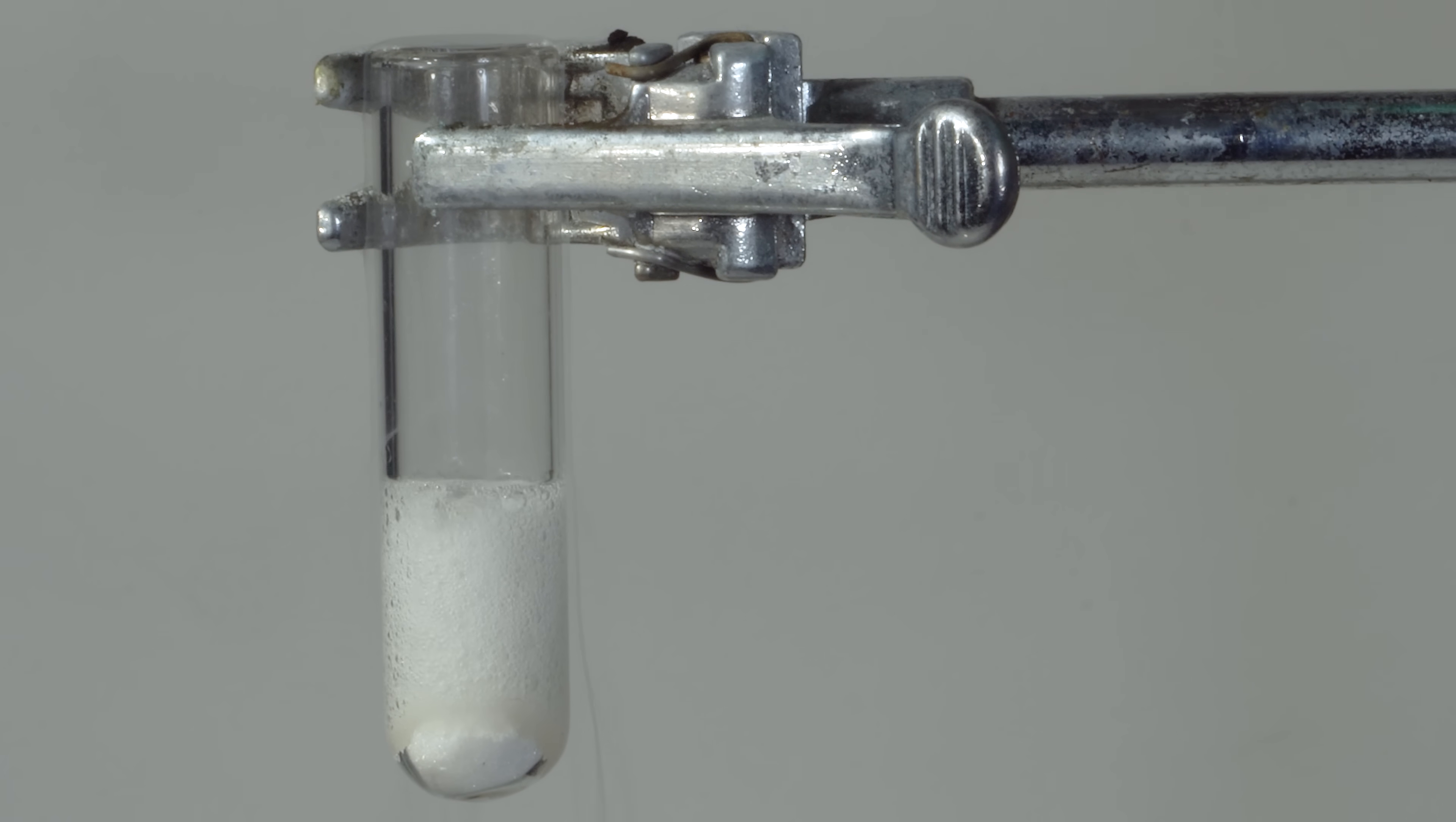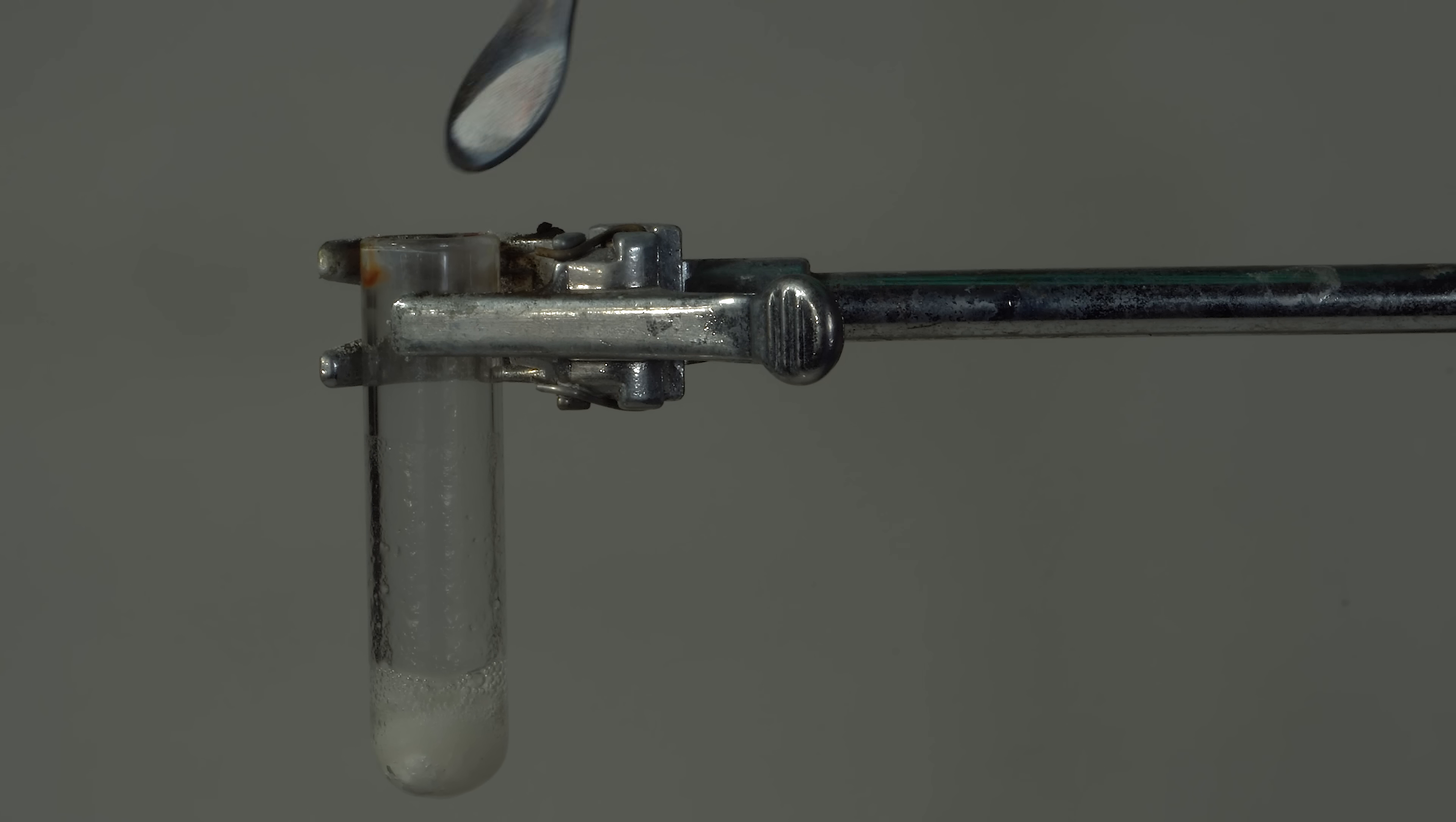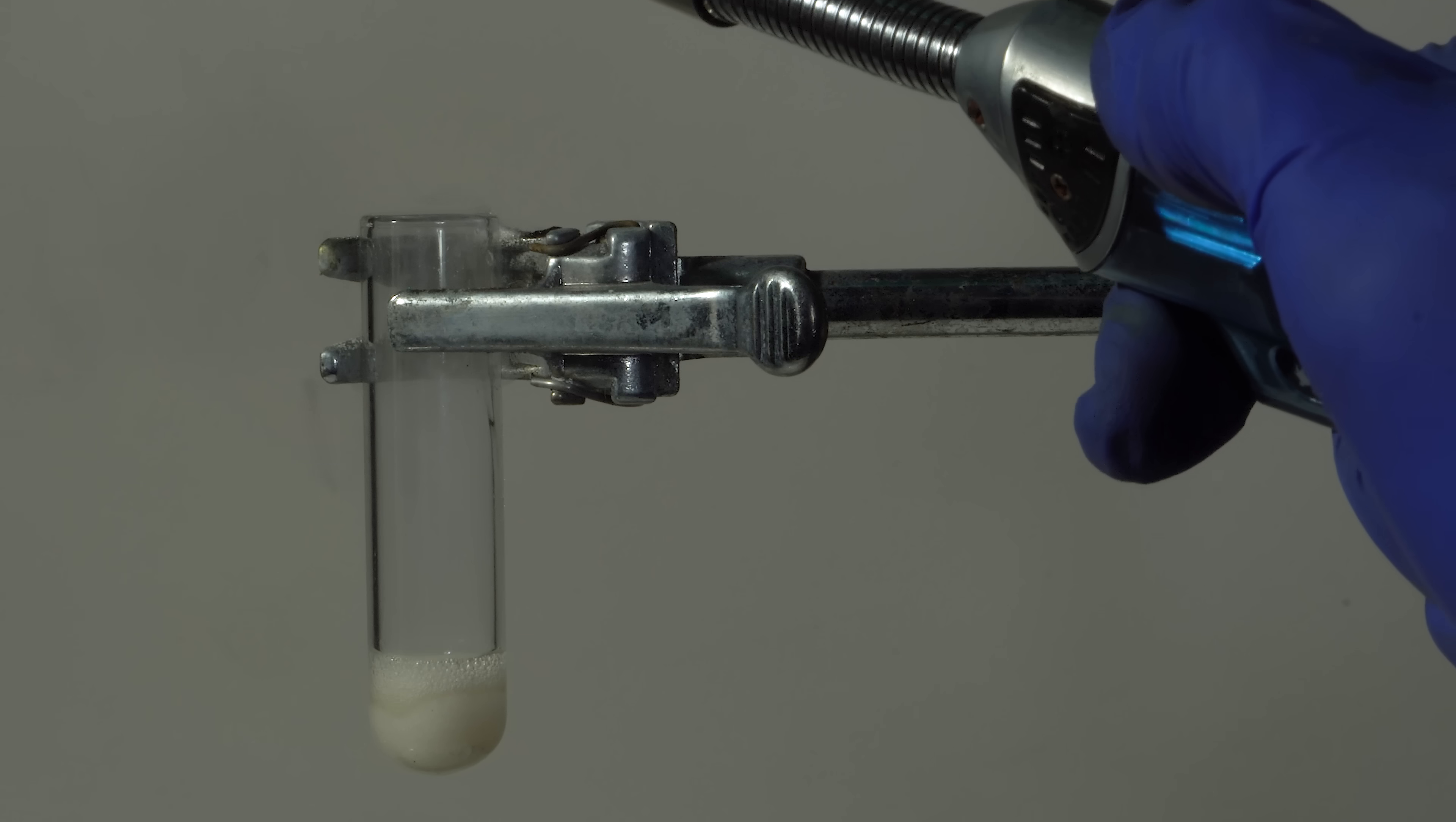We can see that by making it contact with some red hot metal powder, like titanium, magnesium or iron.